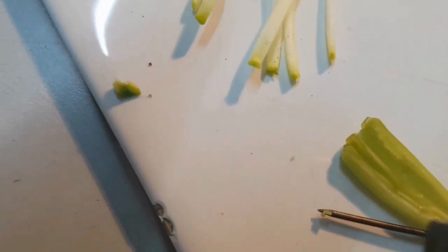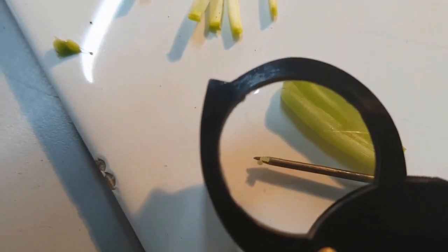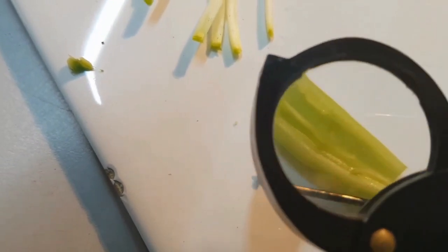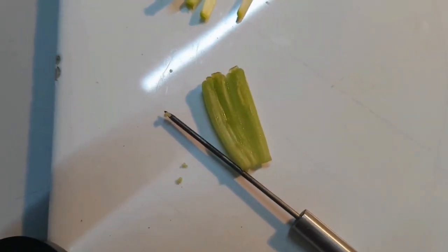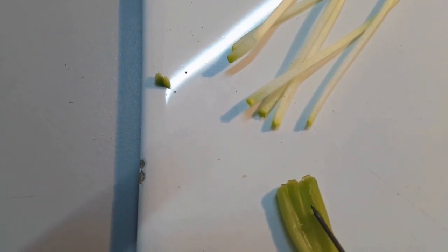The experimenter has searched inside it and found small round structures. The experimenter has found egg cells, also known as ovules. If the plant was fertilized, these ovules would then become embryonic plants and then later on seeds. The ovary that you see split open here would become the fruit that surrounds the seeds.